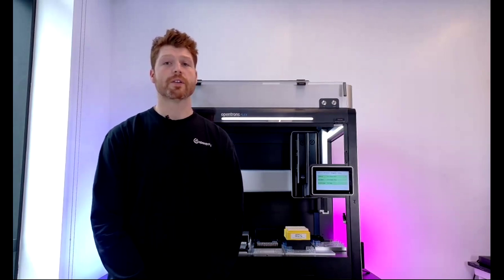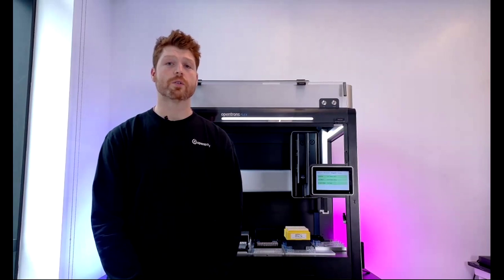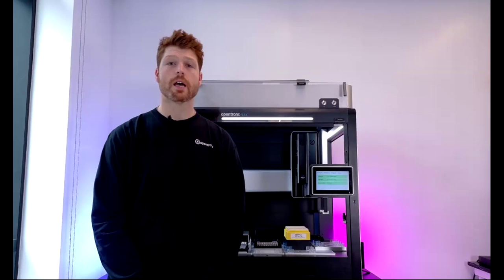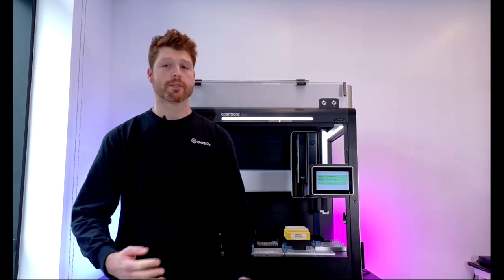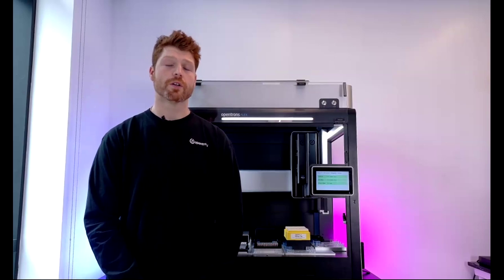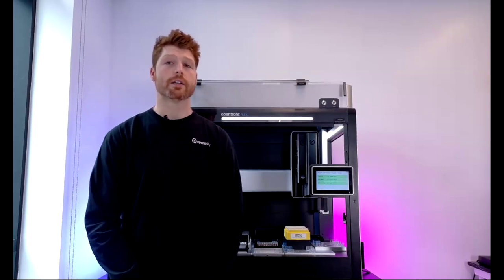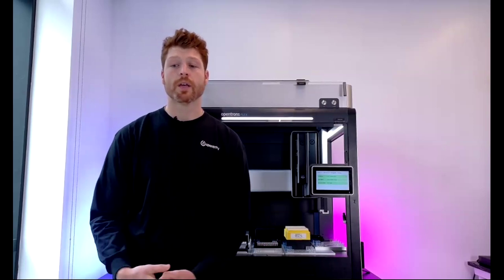To find the protocol that fits our needs, we can search, or we have a pretty extensive filtering tool set, which is going to allow us to browse based on a category such as application. Today, I'm going to be showing you a trypsin-based digestion, and there are going to be several that pop up. I'll show you also how to filter through those to find the one that's best going to fit your needs and the relevant robot information that you'll have up.